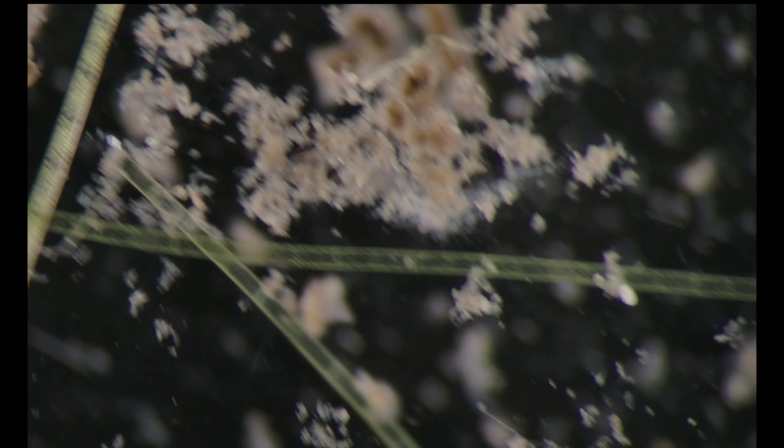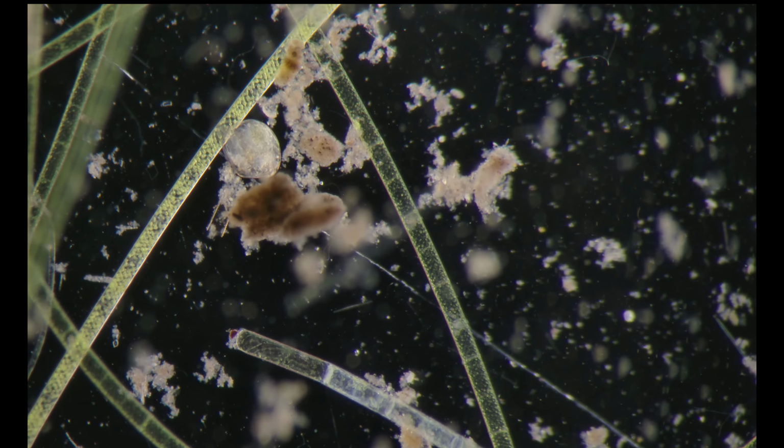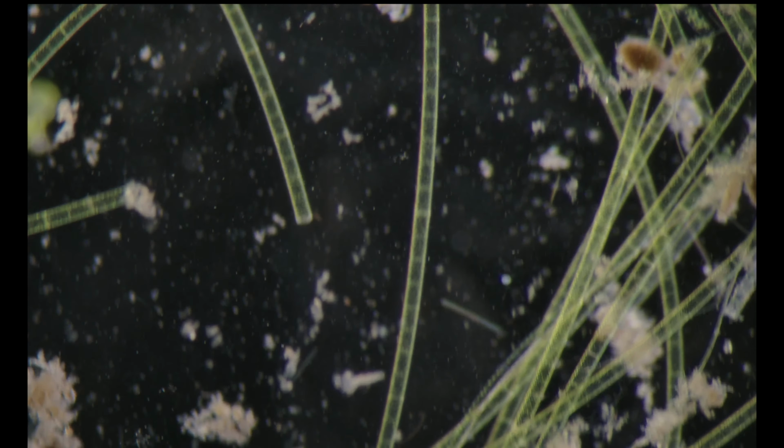And I think that's enough for today, as getting to know the potential of the stereo microscope when dealing with protozoans.